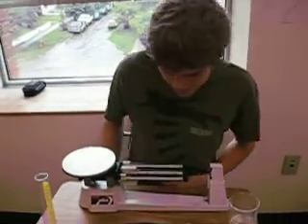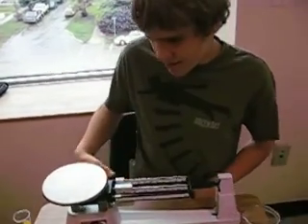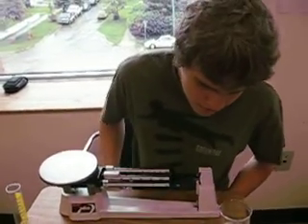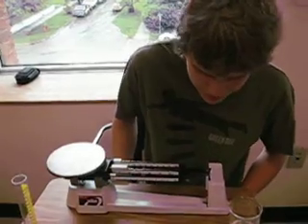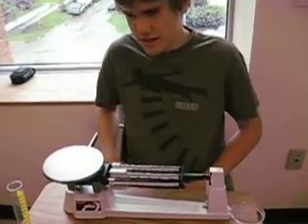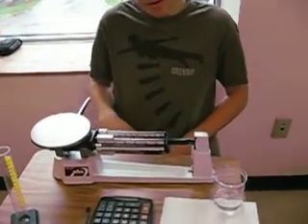Hi, I'm Jacob Lenboy, and today we are going to find out different masses of different liquids.